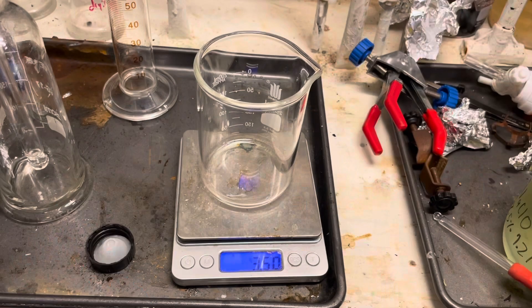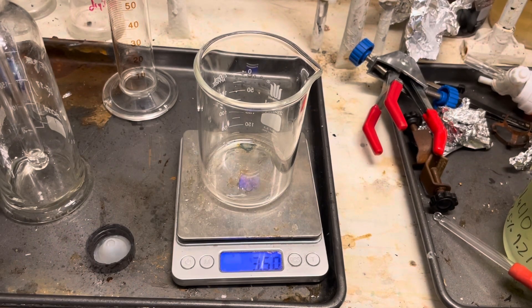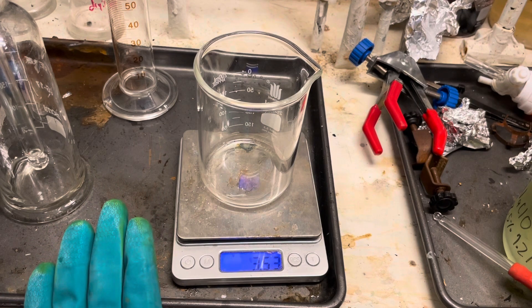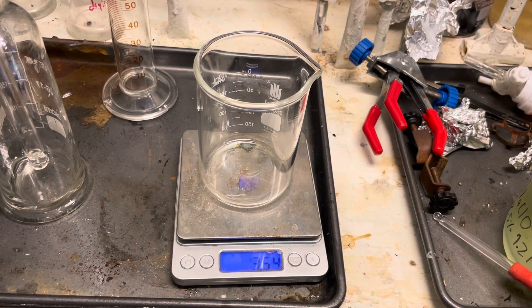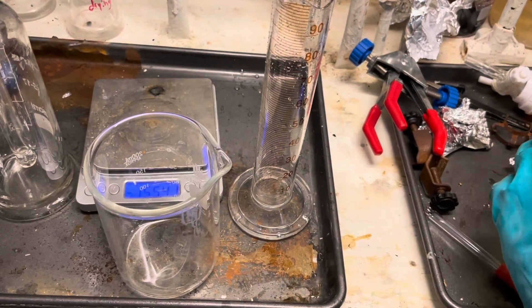We know the density so you can figure out the volume of it. You can see it's slowly absorbing moisture from air because it's increasing in mass, quite fun.